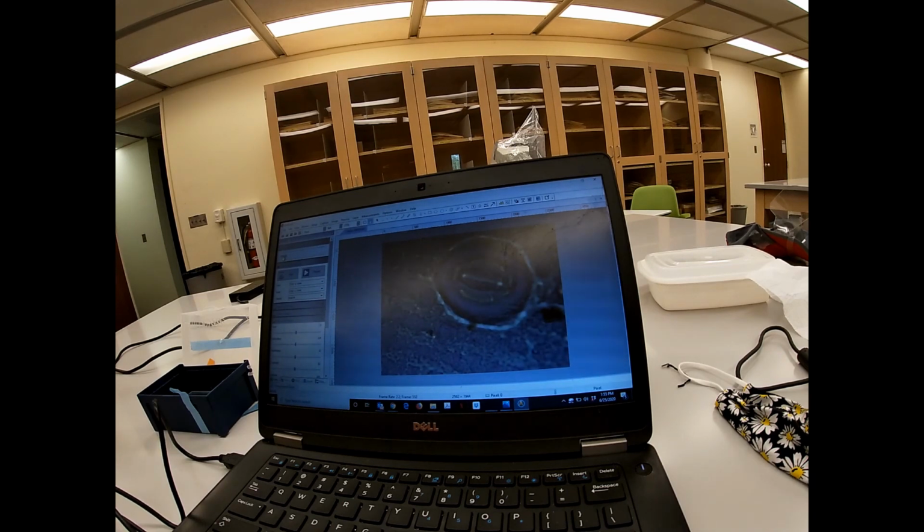There we go. So that, my friends, is a stomate, a singular stomate on the surface of a leaf of mother-in-law's tongue. I'm changing the focus slowly here, and that's why it's blurring in and out. You're going to want to get a nice close-up image of a stomata. Ultimately I'm going to want to measure that, and so I am going to want to take a picture of that.